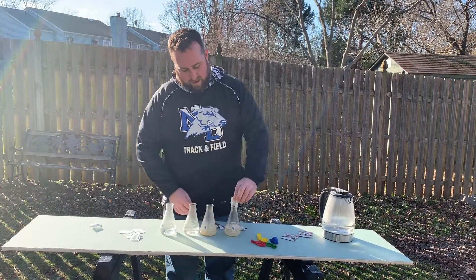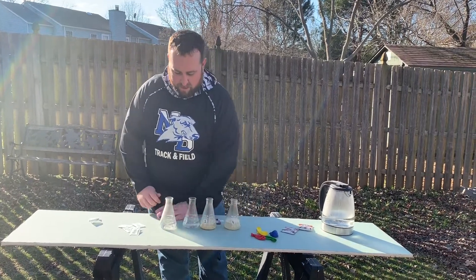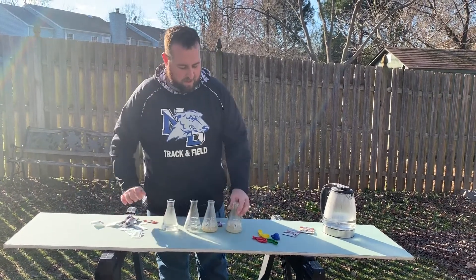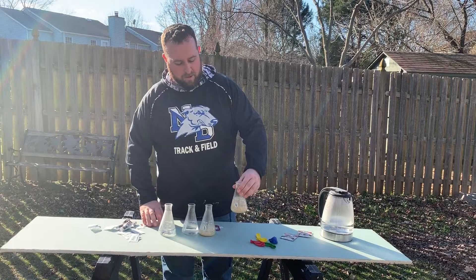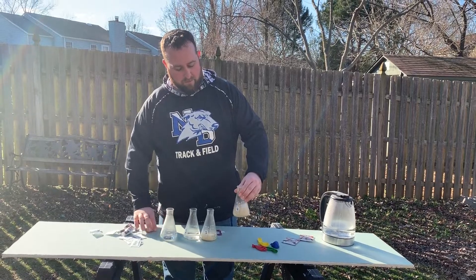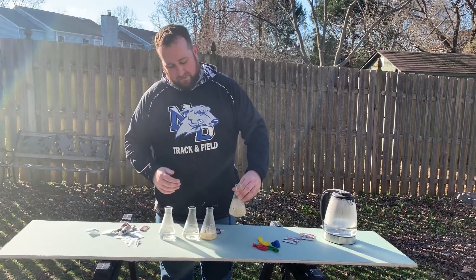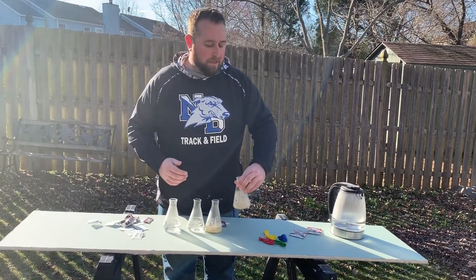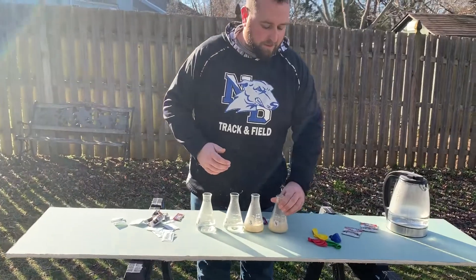They're in Erlenmeyer flasks, so I can actually mix these up. And I'm going to put a balloon over the top of them to trap any kind of gases that could be contained within these mixtures.